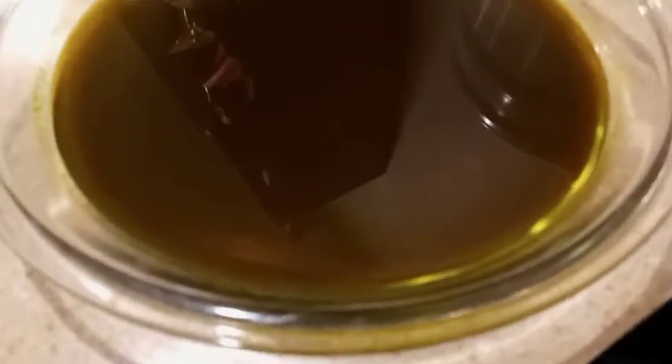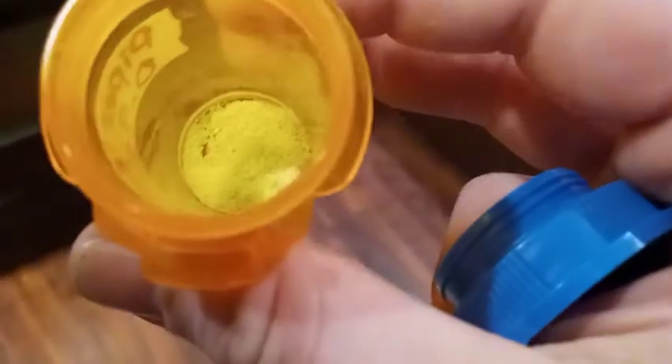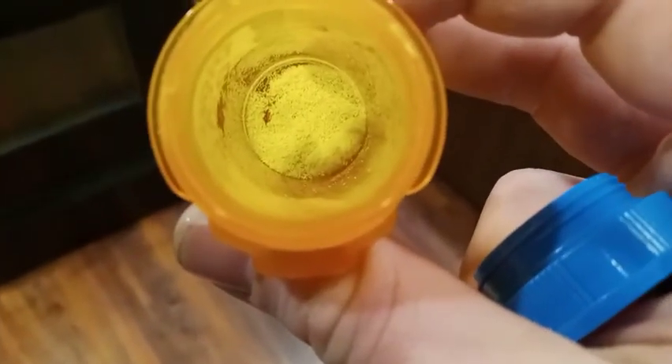For my first procedure doing this I actually discovered something by accident. You can see a little fuzz ball in the back — that's actually part of my filter that I scraped off. The rest of it is fairly pure piperine. I weighed it with that included, but assuming about half a gram. There's a very minor pepper smell and I do believe this is really quite pure, possibly without recrystallization.